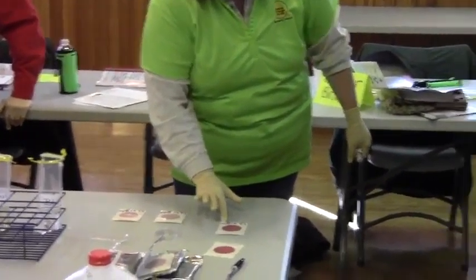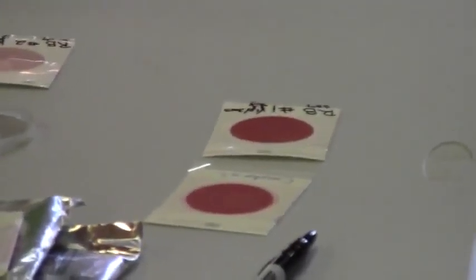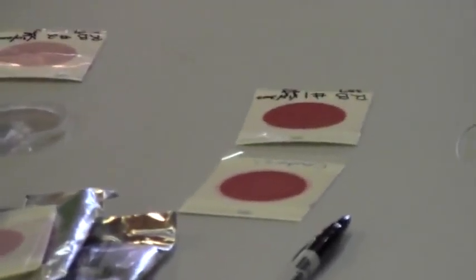And it could be. All right, so we've gotten number one. So we go back again. Can I use the same tip? Very good — number two. Thank you.